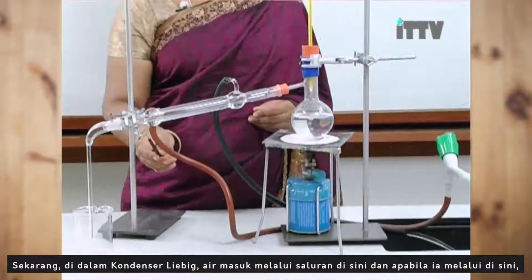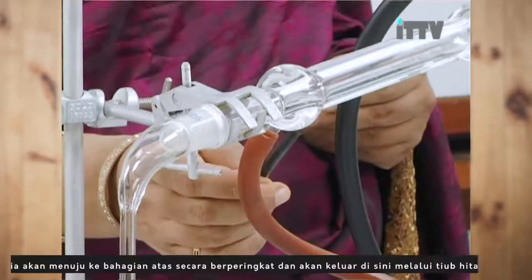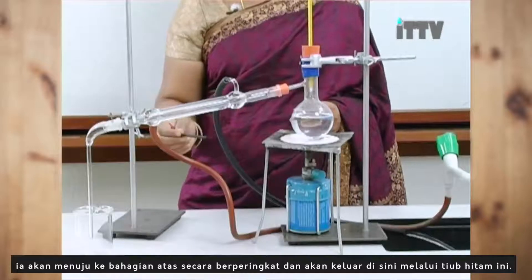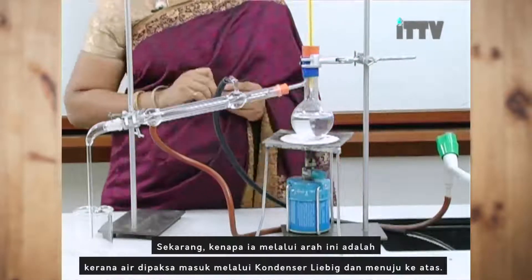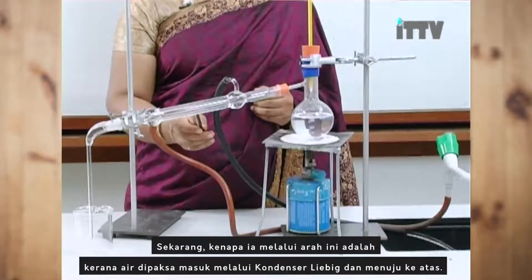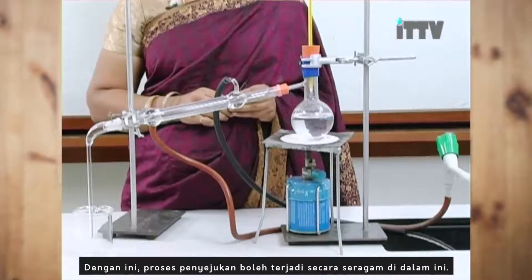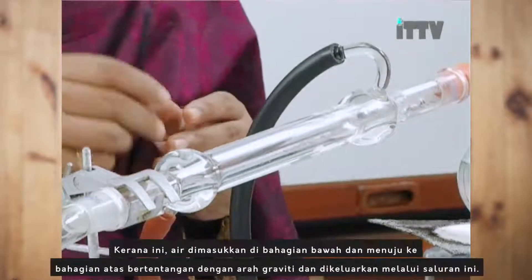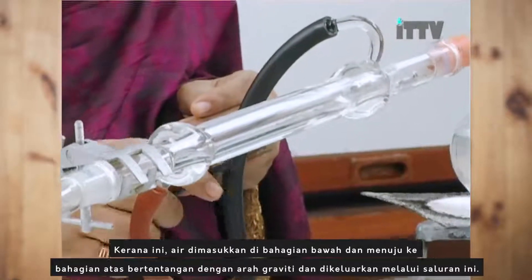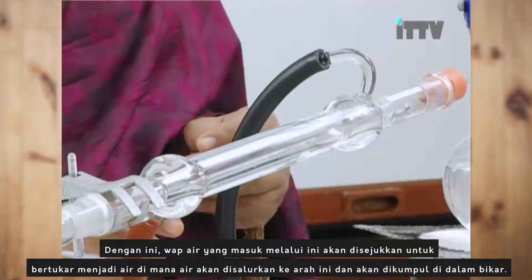Now in this Liebig condenser, the water actually comes through in here, and as the water goes through in here, it goes up gradually and will be coming out through this black tube. The water is forced through this Liebig condenser and goes up. By doing so, the cooling process can occur evenly. That's why water is placed at the bottom, going against the gravitational force, and is channeled out in here.